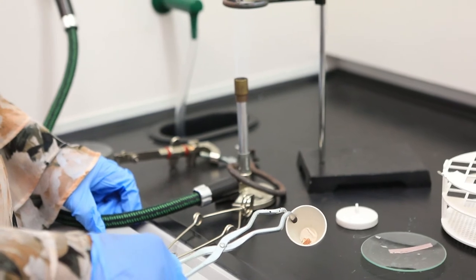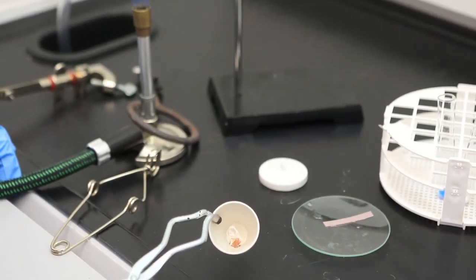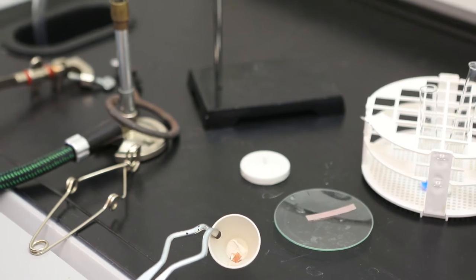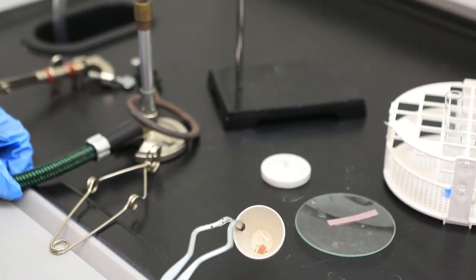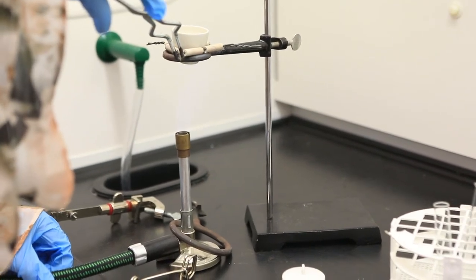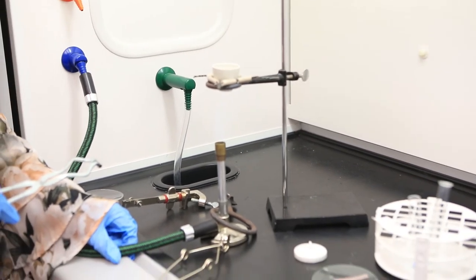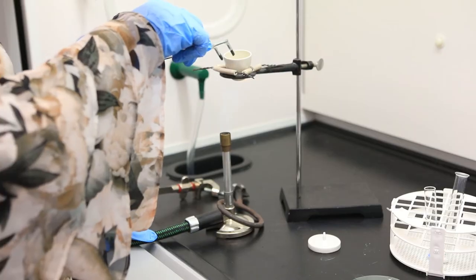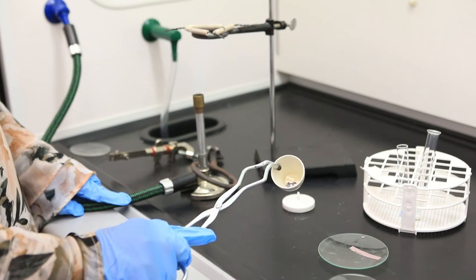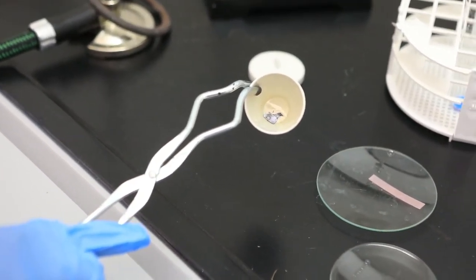In this part of the experiment, we're starting off with copper metal — a shiny reddish-brown solid. The goal is to allow copper to react with atmospheric oxygen, O₂. We'll see exactly the color of the compound that is formed. It's going to be allowed to heat using our crucible and clay triangle for a few minutes. Now that the heating process is complete, you should be able to observe the formation of that black solid, which represents copper(II) oxide.